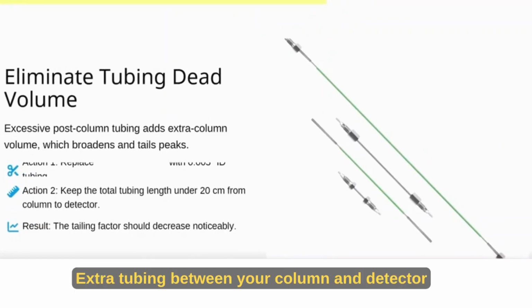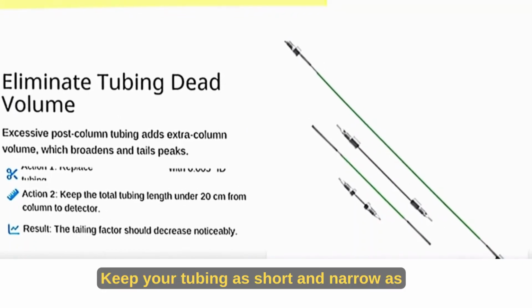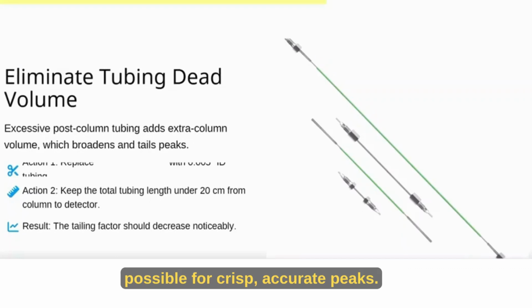Eliminate tubing dead volume. Extra tubing between your column and detector adds unwanted volume. This broadens peaks and creates artificial tailing. Keep your tubing as short and narrow as possible for crisp, accurate peaks.